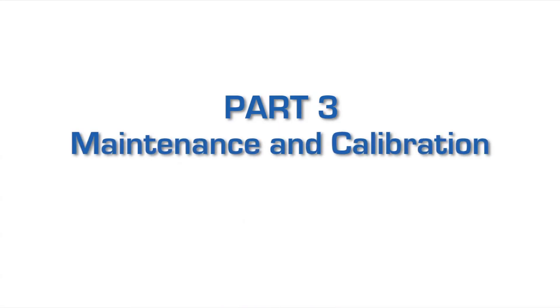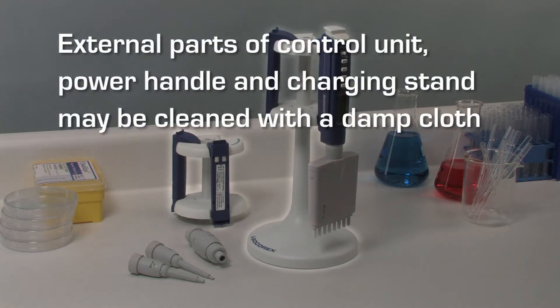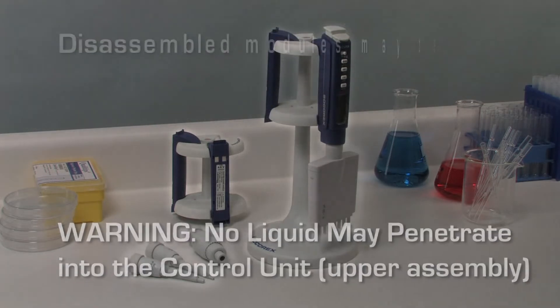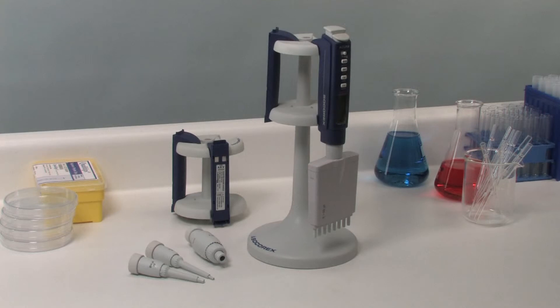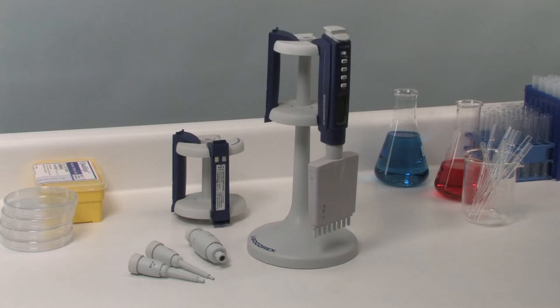The Acura Electro requires little maintenance. To obtain long-term, trouble-free use, pay special attention during pipetting and perform regular cleaning. External parts of the control unit, power handle, and charging stands are cleaned with a dampened cloth. Volumetric modules, once disassembled, can be cleaned or soaked in appropriate decontamination or disinfecting solutions. Ultrasonic baths help to remove sticking residues. Any defective part must be replaced. Refer to the operating instructions for further details, and order original spare parts from authorized dealers.